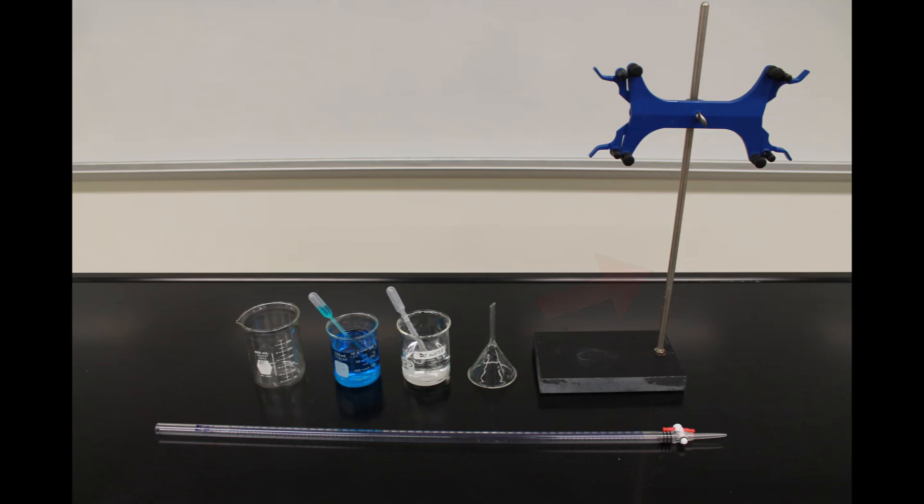Here is what you're going to need. A burette stand, a burette, a funnel, a waste beaker, the liquid going into your burette, and deionized water with a dropper.